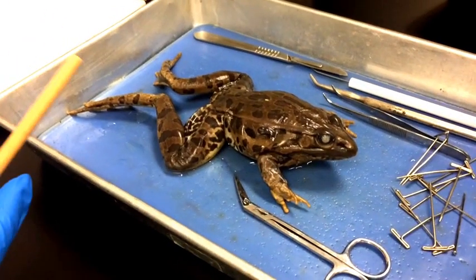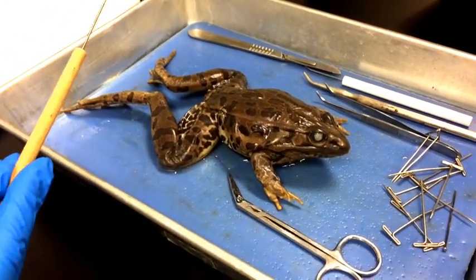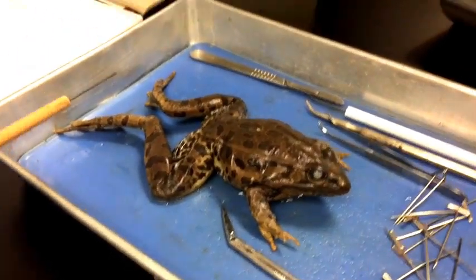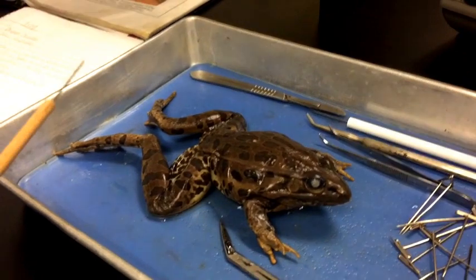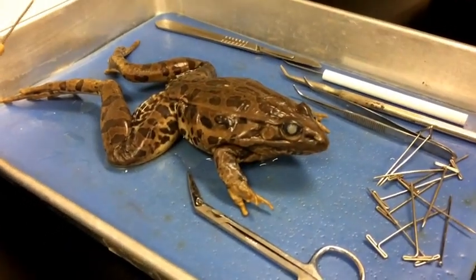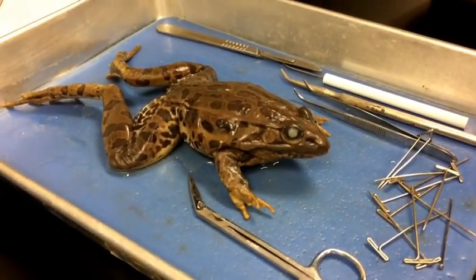My name is Jill. My name is Rayna. My name is Stephanie. And today we'll be doing a dissection of this frog. The frog belongs to the amphibian class in the Chordata phylum.